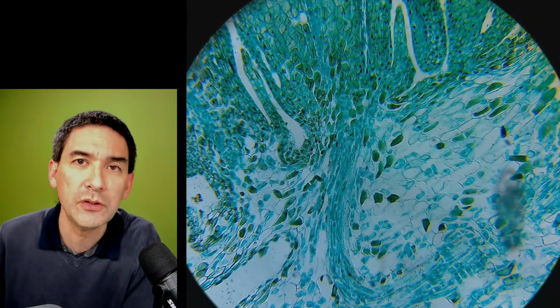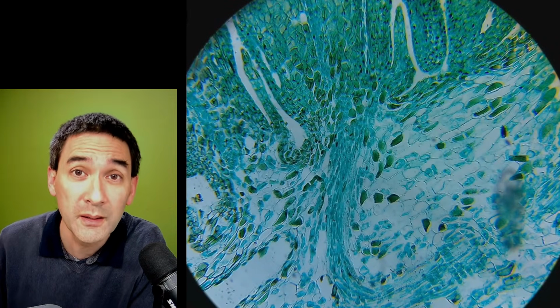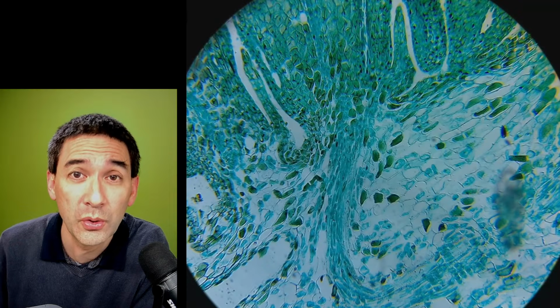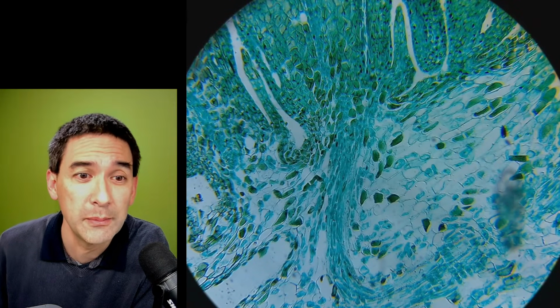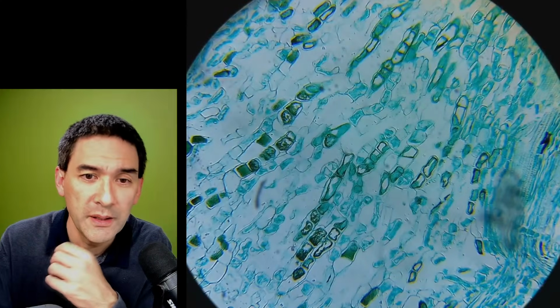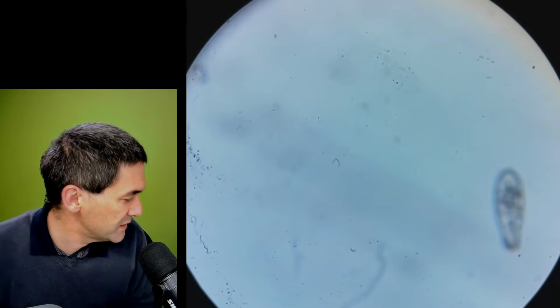Usually to get the image into the computer, sometimes you can use Wi-Fi. I do not want to do that because the transmission is slower and also a little bit more unstable. And right now I'm using a USB connection. And, this dirt on the lens disturbs me.